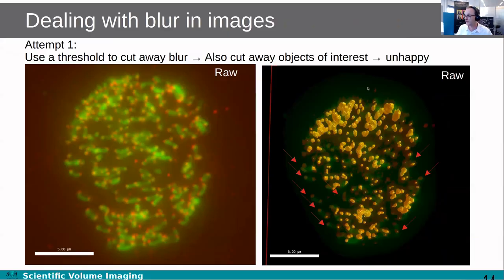So what you can try to do to counter that is increase the threshold that you use to threshold your data, to say I only count it when it is higher than so and so much. You can see it increases a little bit here, but then here at the sides, all these places start to drop below the threshold. So that's also not a solution, of course.